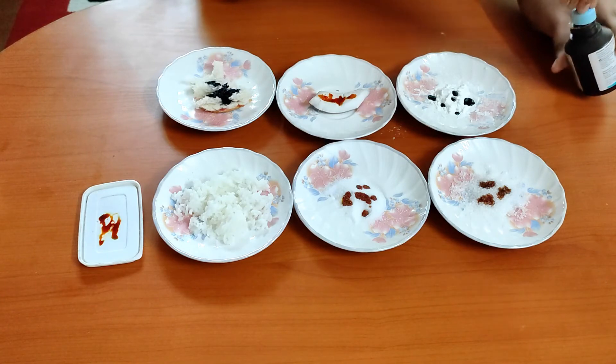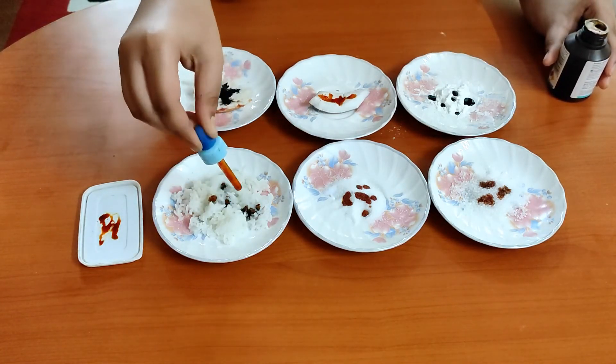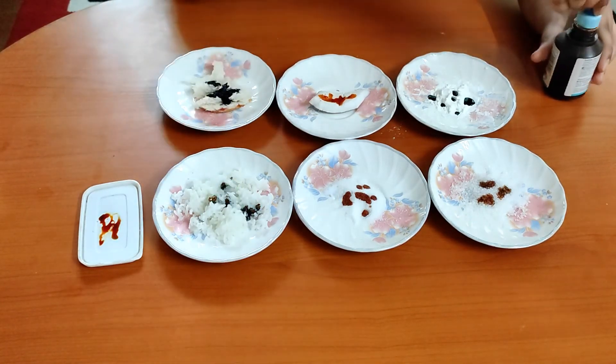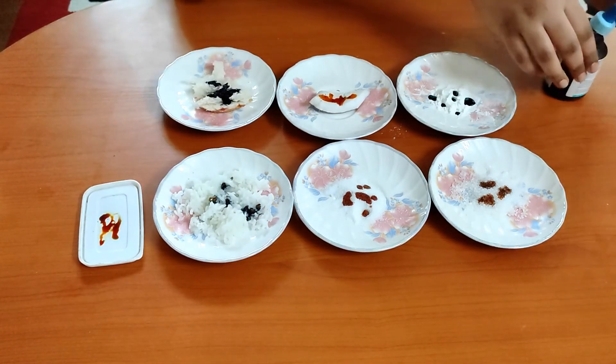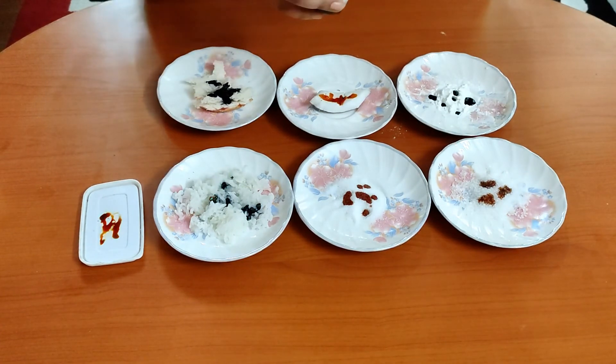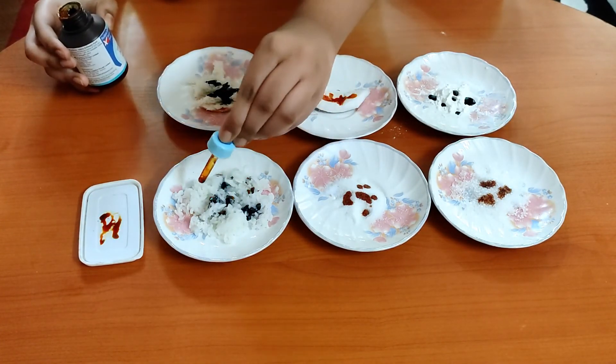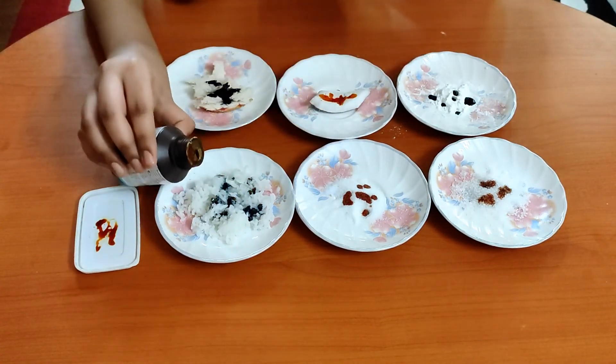Why does the color change to bluish black? Iodine reacts with starch to form a bluish black compound. The bluish black color is basically the formation of polyiodide chains from the reaction of starch and iodine.